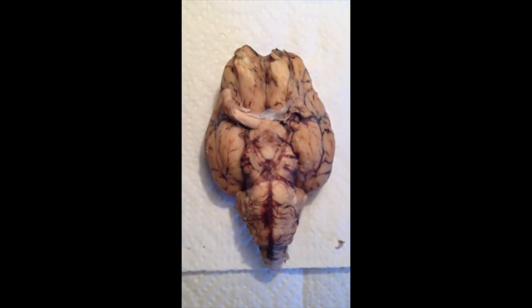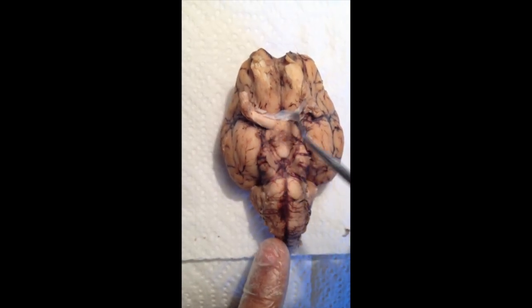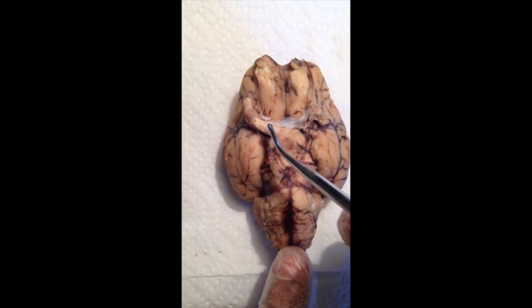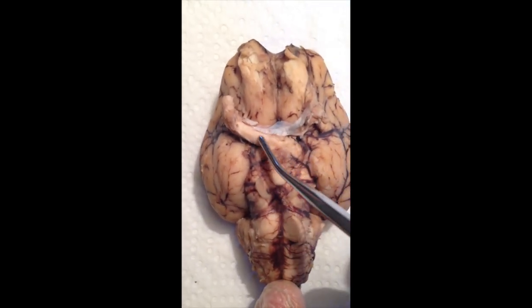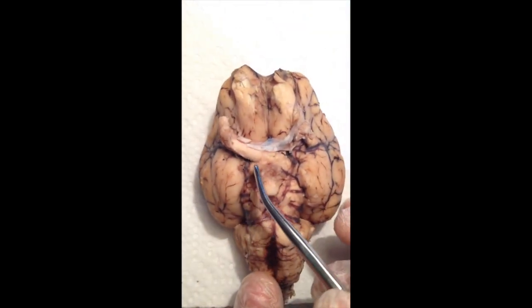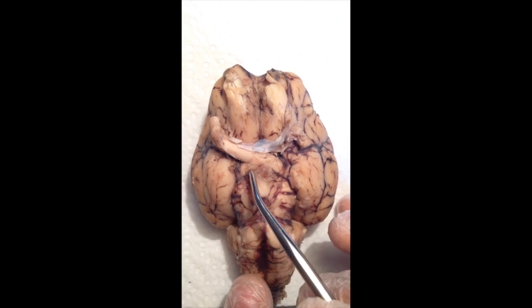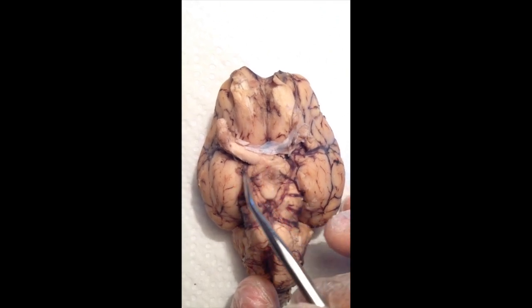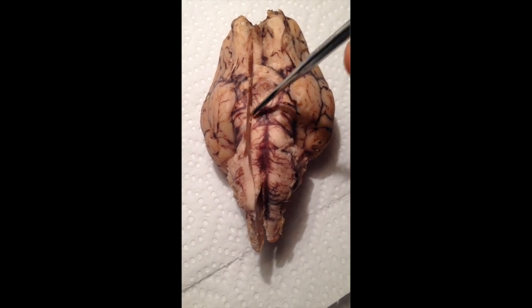Our optic nerves are found here. Our optic chiasma is these two, basically the arch in the middle. And our optic tract, you can barely see it on the sheep brain, but it comes from our optic chiasma out this way, out laterally. Right here, then we have our oculomotor nerves, right here in the middle, and here.